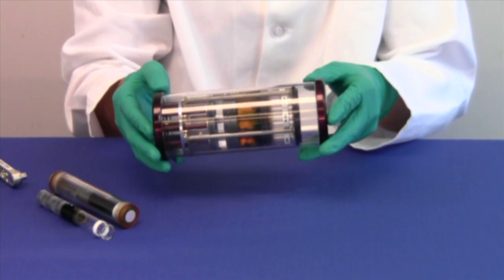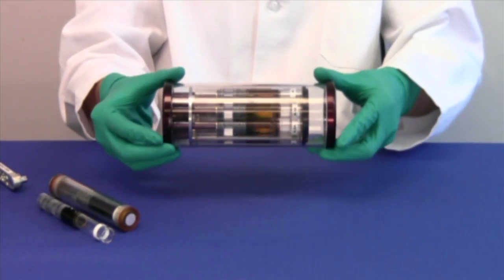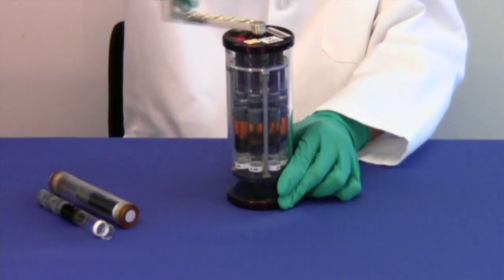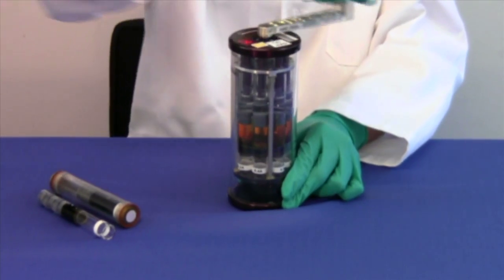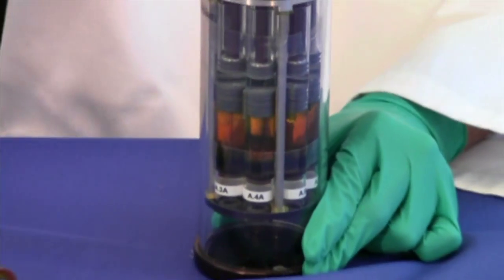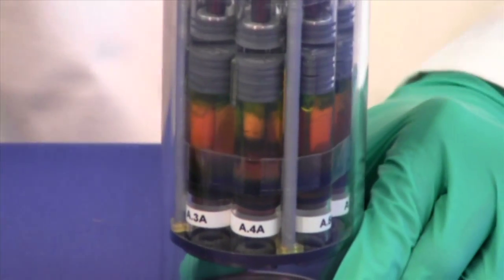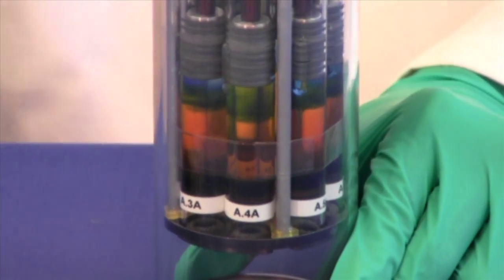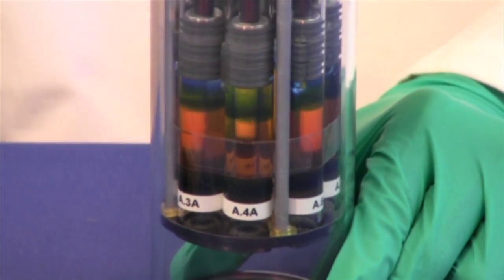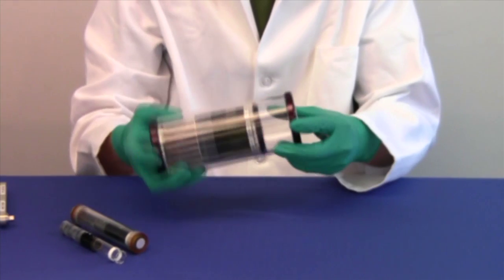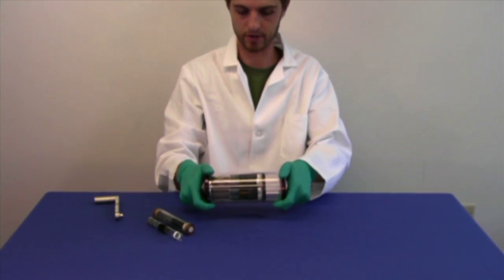Producing the color change as expected. Now mixing in the second chamber. The color is returned.